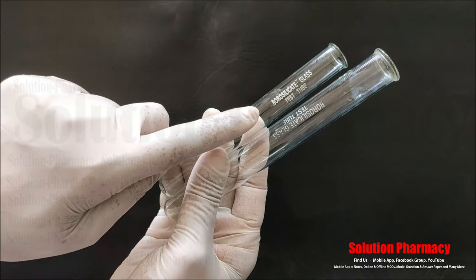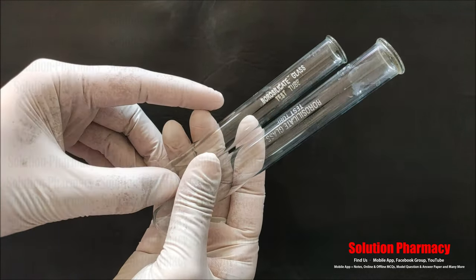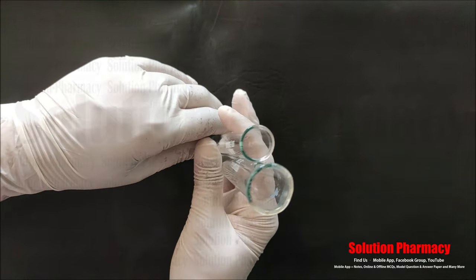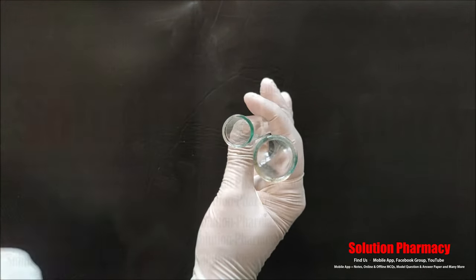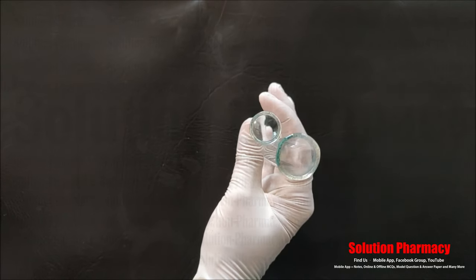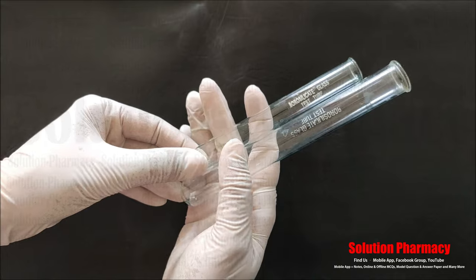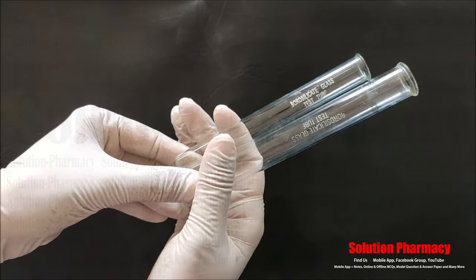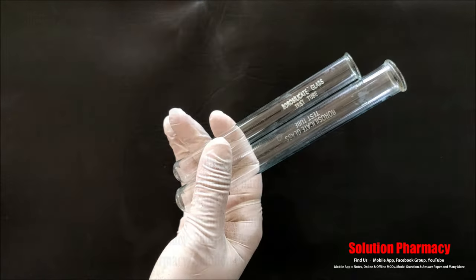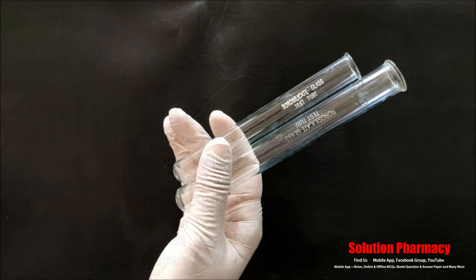Next, this glassware is called a test tube. You can see here there are two sizes of test tubes, both made of borosilicate glass. We generally use the test tube for different qualitative tests and chemical identification tests. Because it is borosilicate glass, we can add chemicals, reagents, and liquid, and we can heat or boil it.